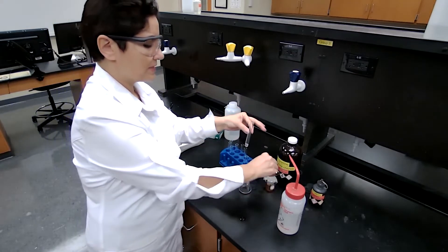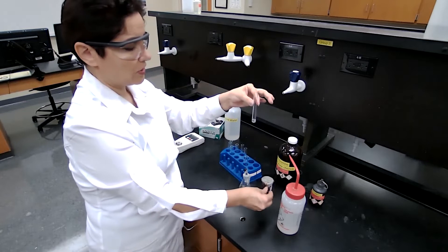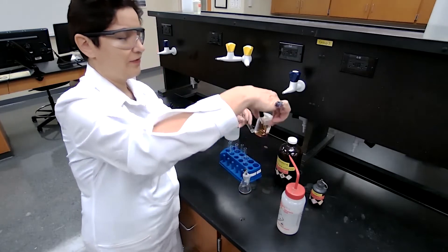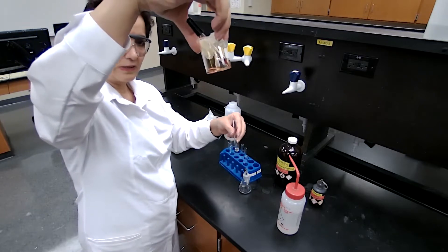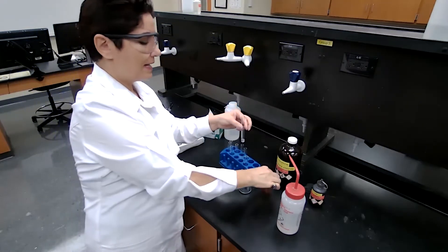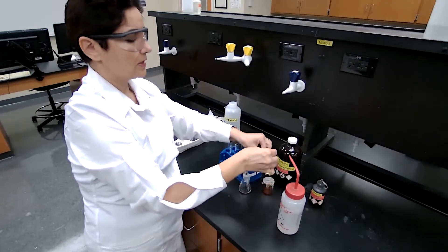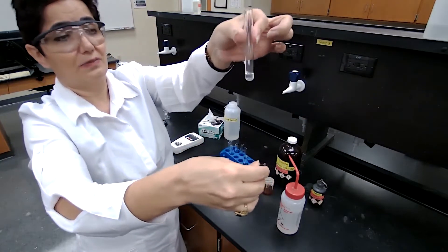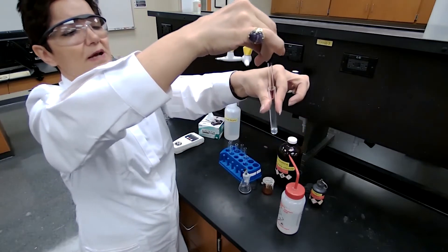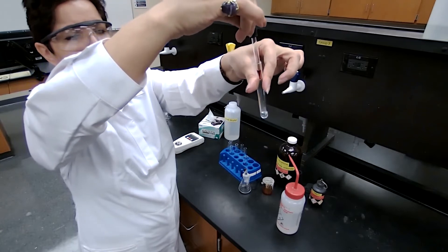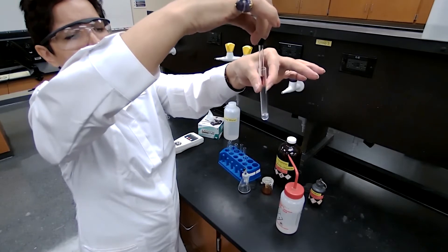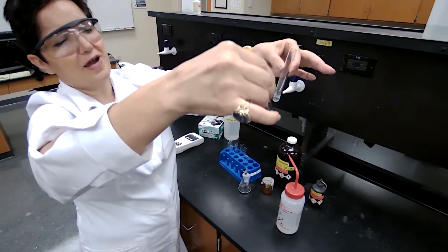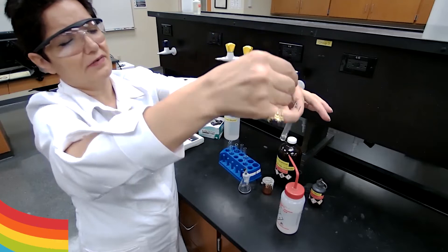What is the positive test? If the color of the bromine disappears, the bromine is orange color. If that color disappears, that means the compound we are testing contains a C=C double bond, a carbon-carbon double bond. And you see that it did disappear completely. I'm just showing you for the record. It keeps disappearing. So I added five drops and it did disappear. Definitely there is a C=C double bond. The color of bromine disappeared.